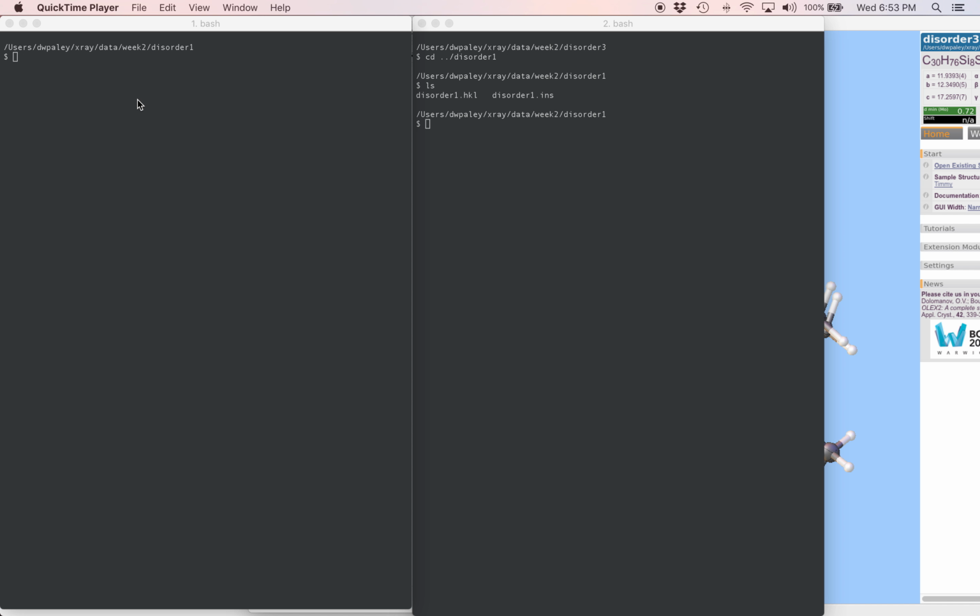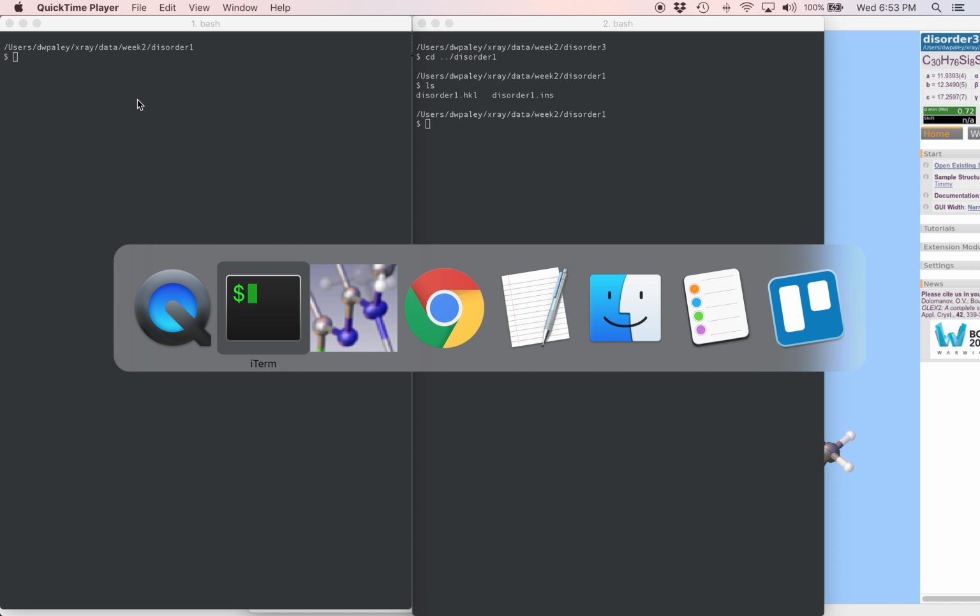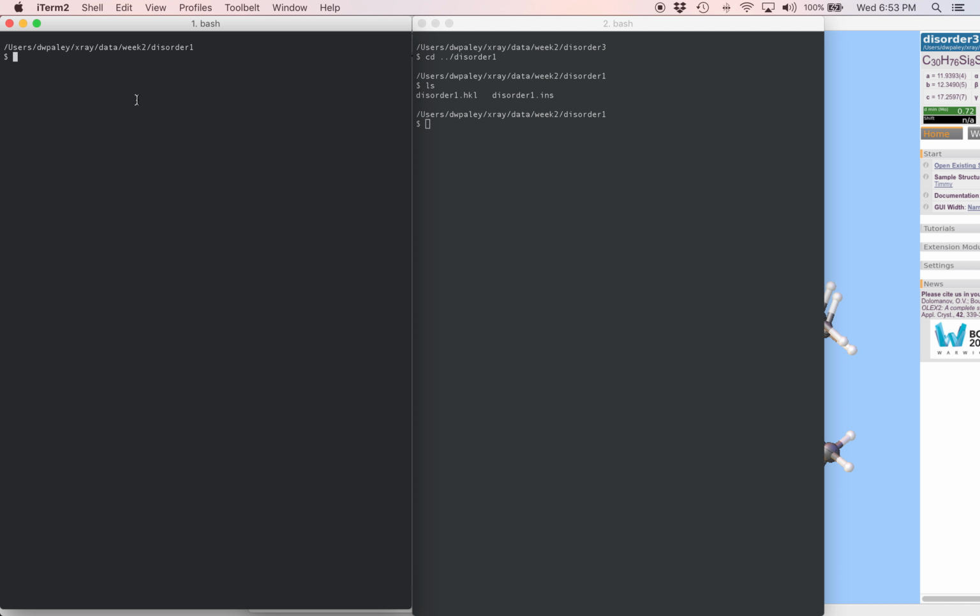Hello, let's work on our first disordered structure. I'm here in my terminal and I've got the directory open with the INS and HKL files in it. So I'm going to get started with SHELXT like we did in the last video.